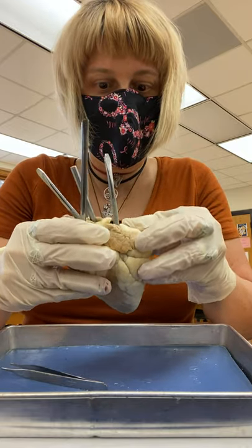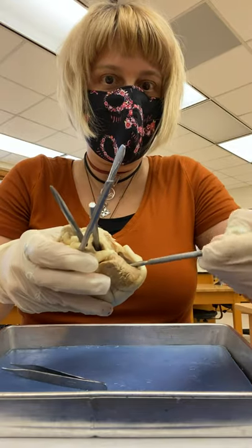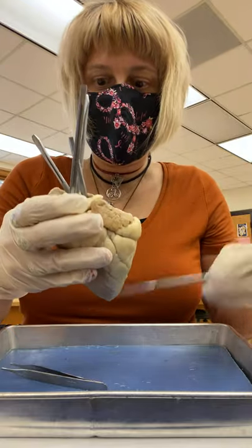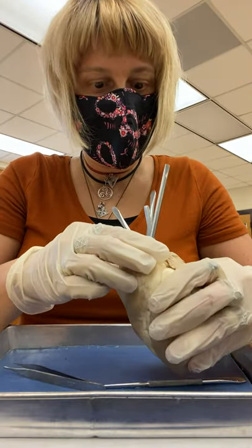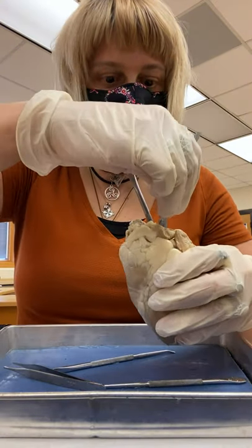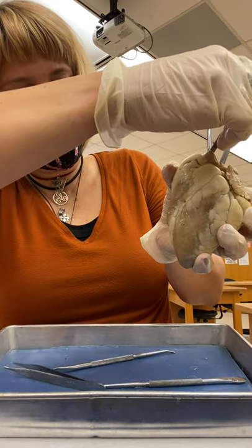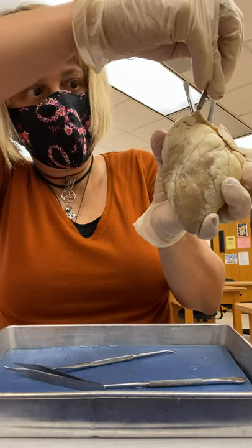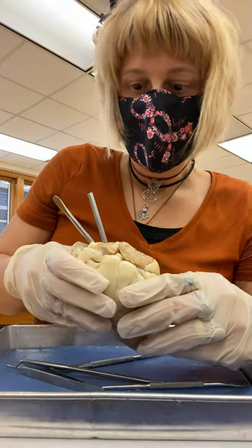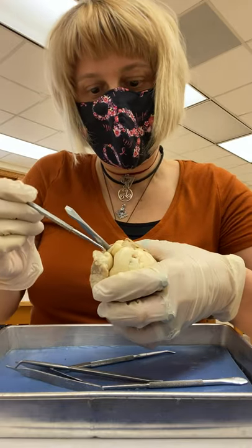On this side, I can see I've got vessels coming in here — these are the pulmonary veins coming into that left atrium. I don't want to confuse anyone, so I'm going to take out the superior vena cava and right here the pulmonary trunk, coming straight from that right ventricle. And I'm left with the aortic. The aortic arch is going to come up this way.